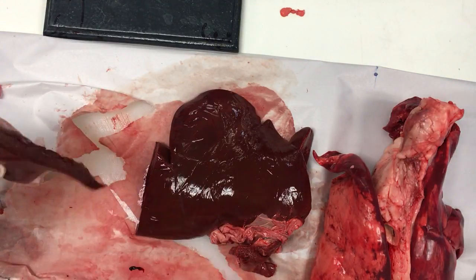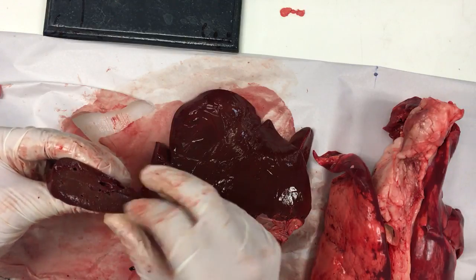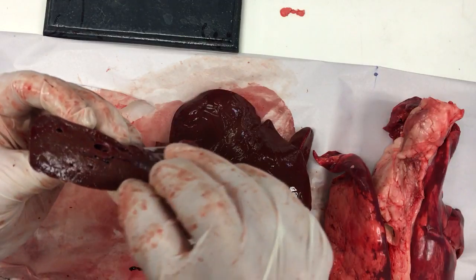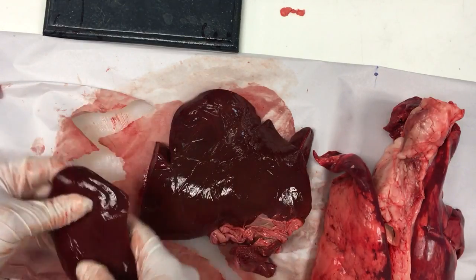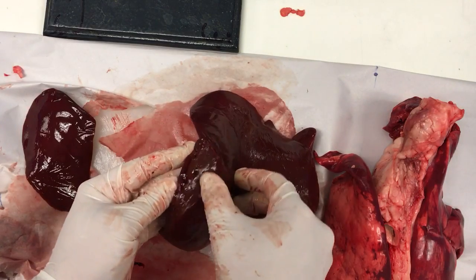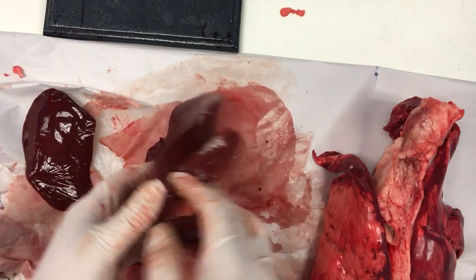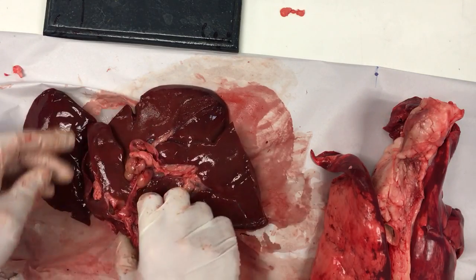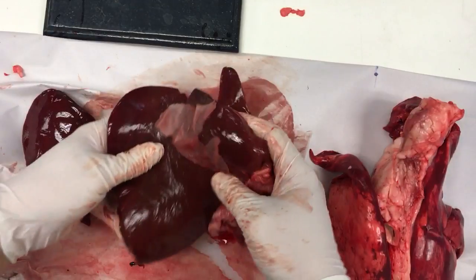You can see there's not a lot of structure inside it, and it's basically where you've got all your fat reserves — it's storage. You can see different layers in there, but really it's just a large storage factory. There's not a lot of detail to it. If I turn it over you can see a lot more detail, but really it's just to get blood in there and blood around it.